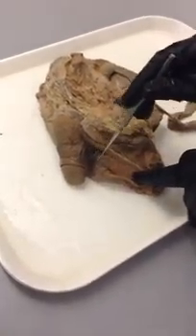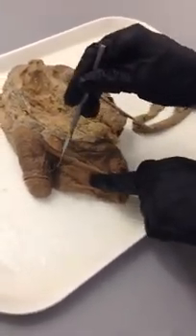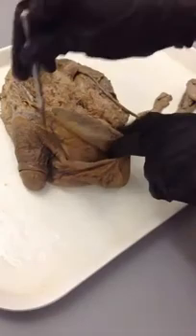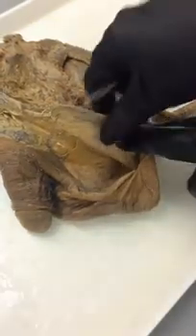Right here is the scrotum — all of that right here is the scrotum, and that's where the testes are found. Within the scrotum you also find a dark distinct line running in the middle, from the penis towards the anus, and that's called the raphe. If we were to make an incision and cut through here, you can see there's a kind of chamber, and this division is called the median septum.